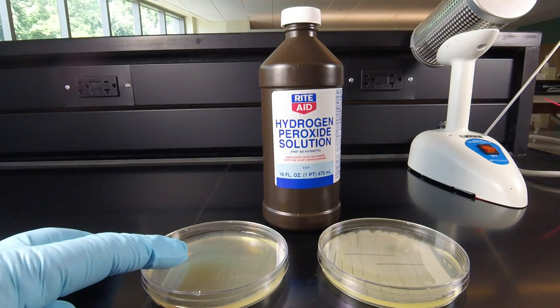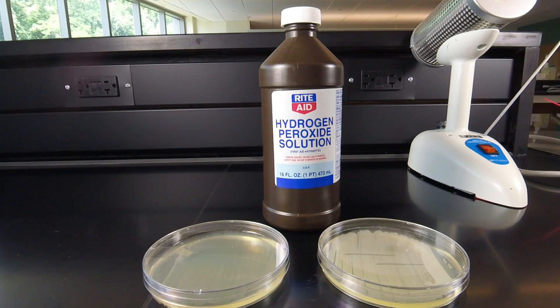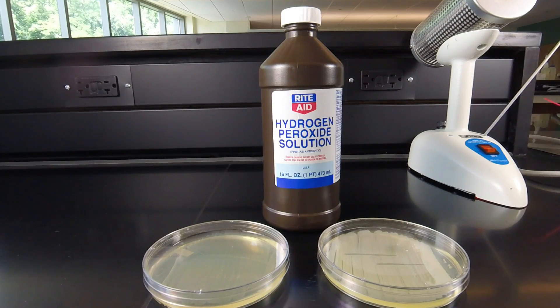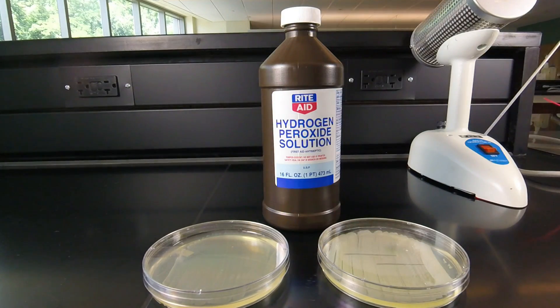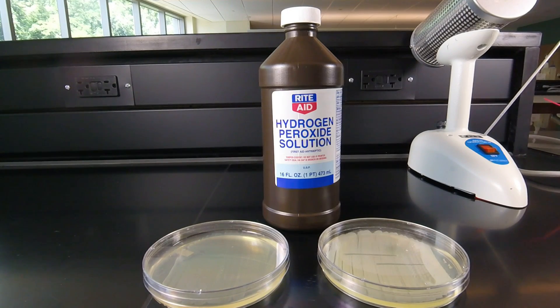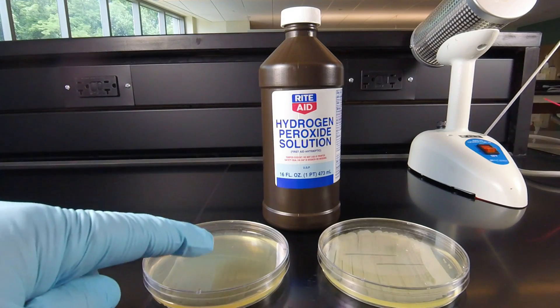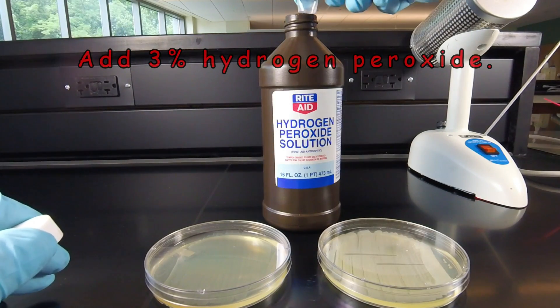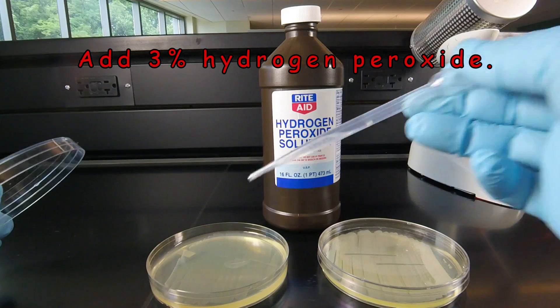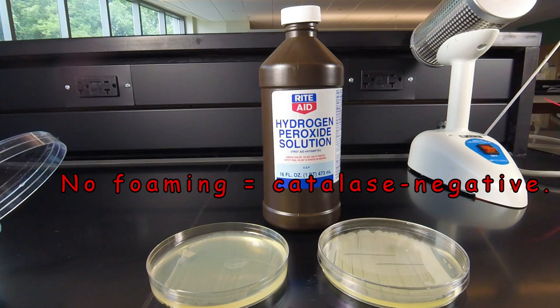On the left here we have a plate of Streptococcus lactis, which happens to be normal flora of milk. The genus Streptococcus gets its energy strictly from fermentation and has no need for the enzyme catalase, so it's catalase negative. It's very simple to do a catalase test — we just add a little three percent hydrogen peroxide to the plate. If we add some hydrogen peroxide to the Streptococcus lactis, we see that nothing happens; it remains hydrogen peroxide and is not broken down, confirming that bacterium is catalase negative.